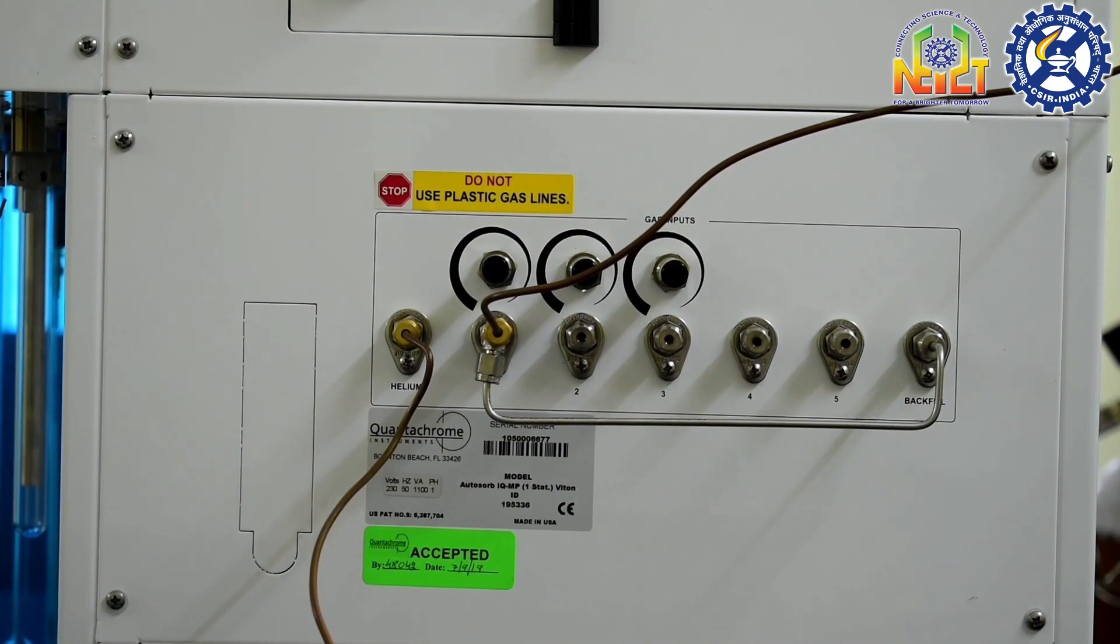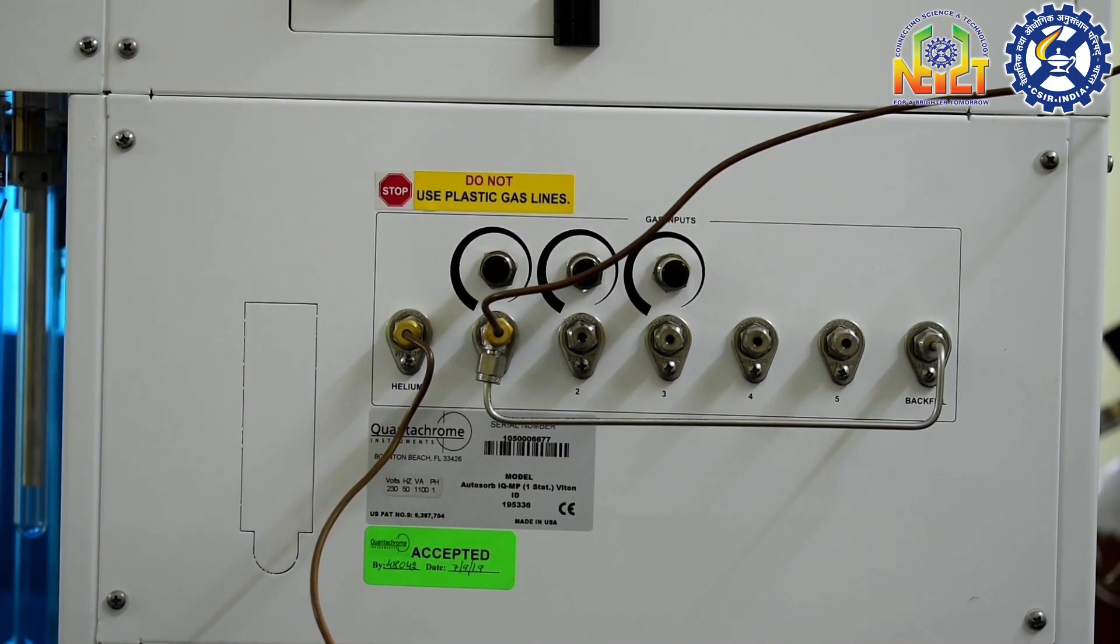The first gas port is only for helium. The helium is used to measure dead volume.